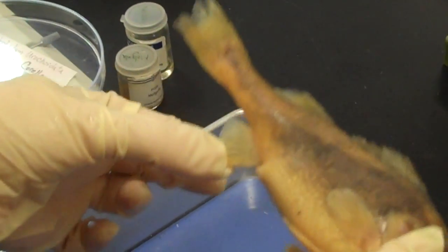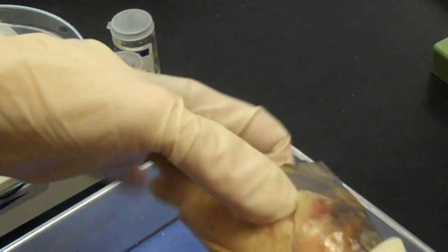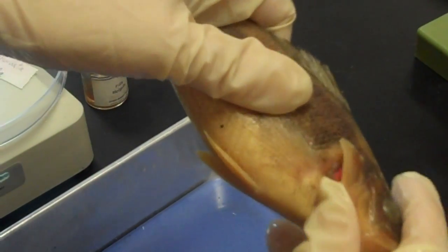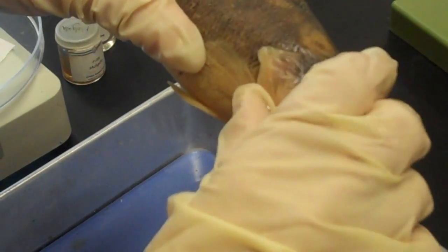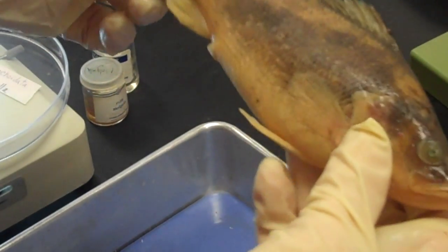This is the fin that the bony fish — the class Osteichthyes — have, but the sharks do not. Also, something different the bony fish have is this bony flap that covers the gill chamber. That's called the operculum, and it's under muscular control, so they can open and close this, and that causes water to pump across the gills for respiration.